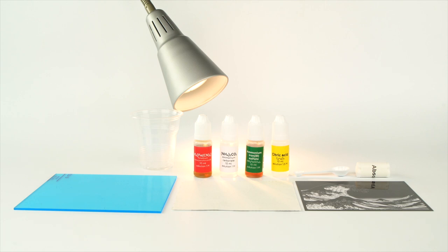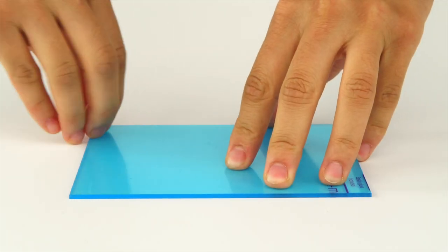Conduct this experiment in dim lighting. Avoid bright sun and strong lamps. Remove the protective covering from both sides of the plexiglass.